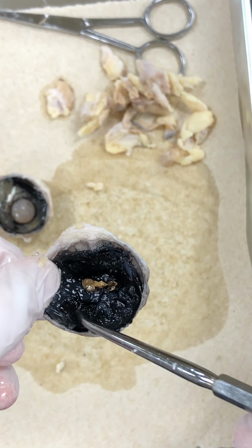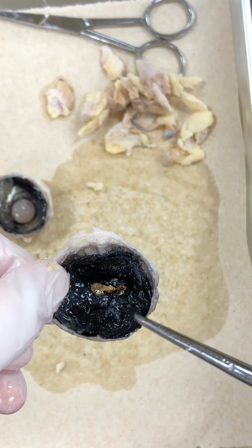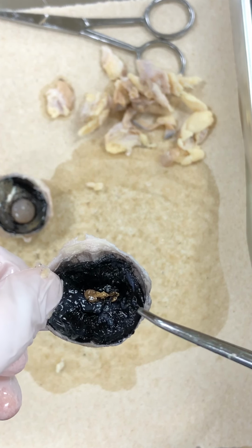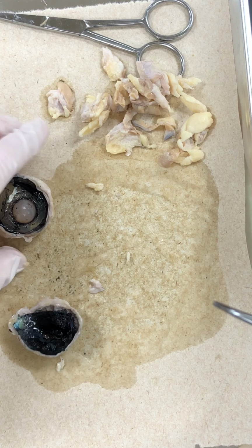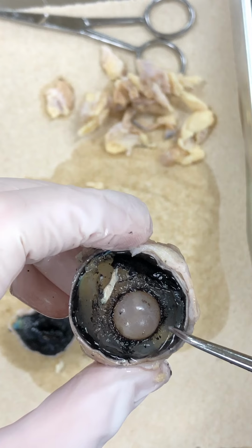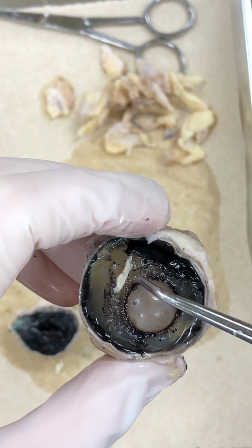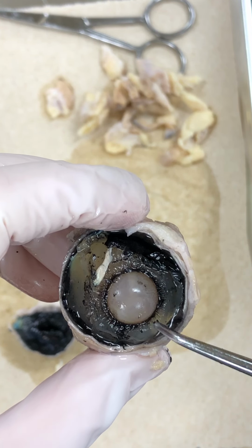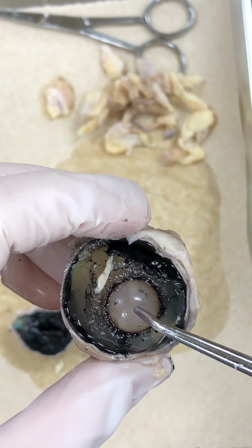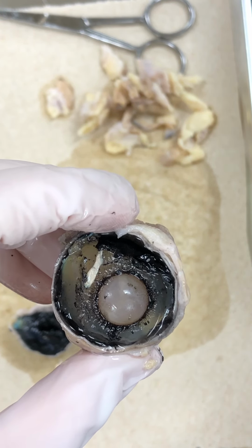Going back to the ciliary bodies, these smooth muscles here, again, they're going to attach to the lens via some suspensory ligaments, which we can kind of see around the lens here. These little black ligaments almost look like they're coming out a little bit, almost like rays of sun outside of the lens. Those are suspensory ligaments, and that's what's going to hold the lens to the ciliary body muscles.